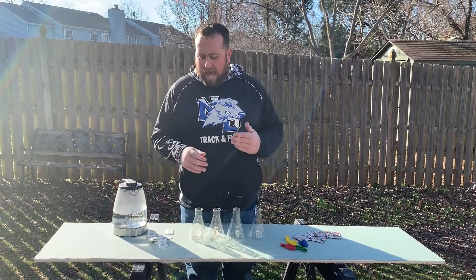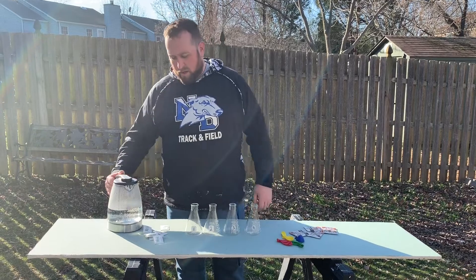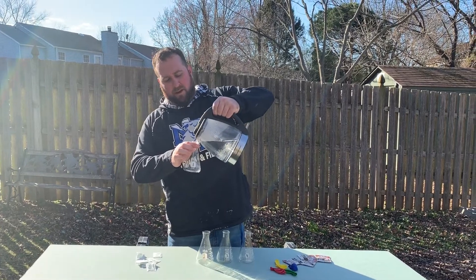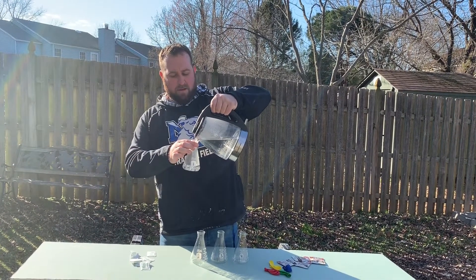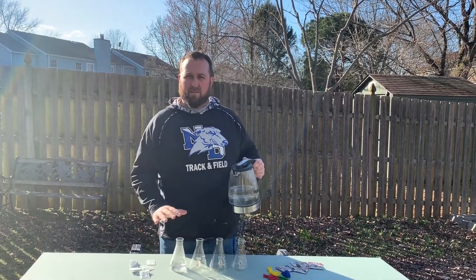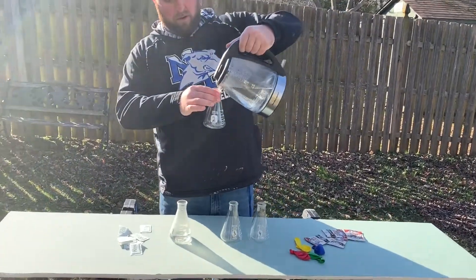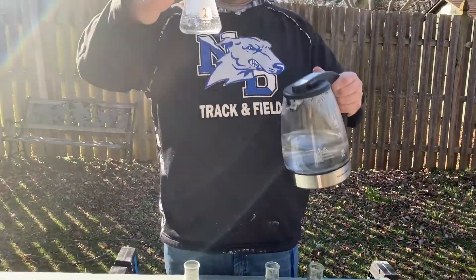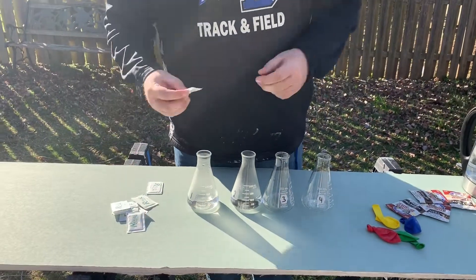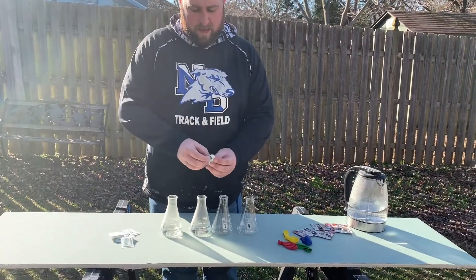We are going to add each of our conditions to our four test tubes. If you follow the procedure, it tells you exactly what's in each one. In test tube number one, I'm only going to add water — I have my Erlenmeyer flask instead of a test tube, and I'm adding in 100 milliliters of water, a little more than the book says so you can see it better. In test tube two, I'm going to add the same amount of water, but I'm also going to add in sugar to see if sugar does any sort of reaction. I'm going to add in two packets of sugar here.